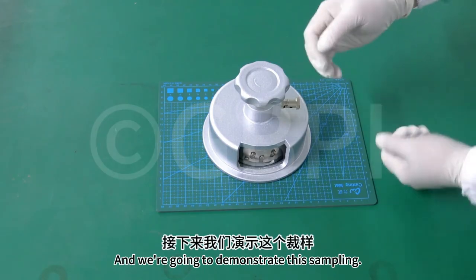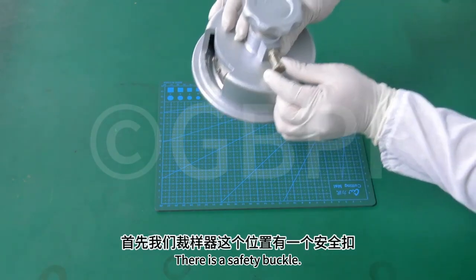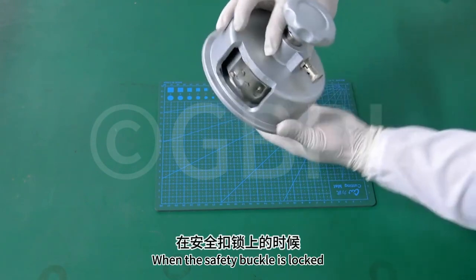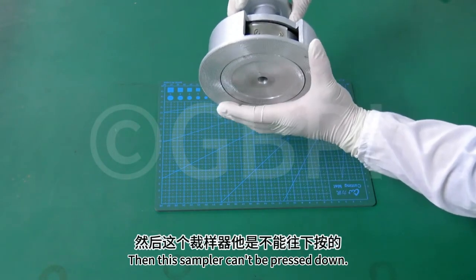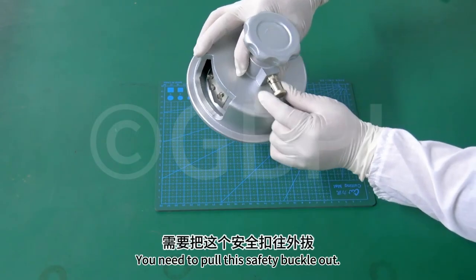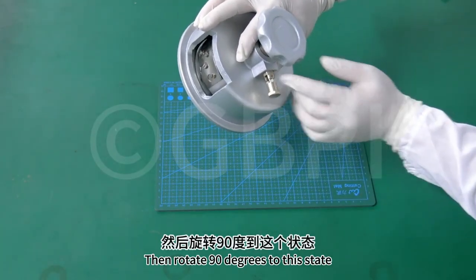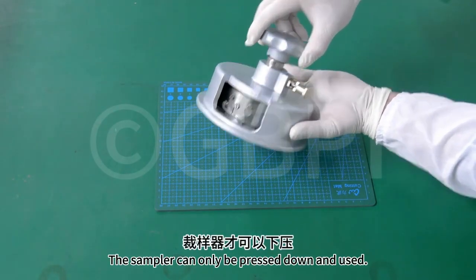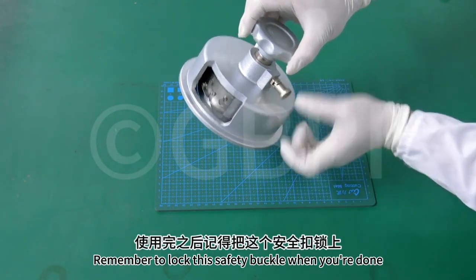And we're going to demonstrate this sampling. So first of all, we have the sampler position. There is a safety buckle. When the safety buckle is locked, this sampler can't be pressed down. So when we want to use it, you need to pull this safety buckle out, then rotate 90 degrees to this state. It's open. This is when we sample. The sampler can only be pressed down and used. Remember to lock this safety buckle when you're done.